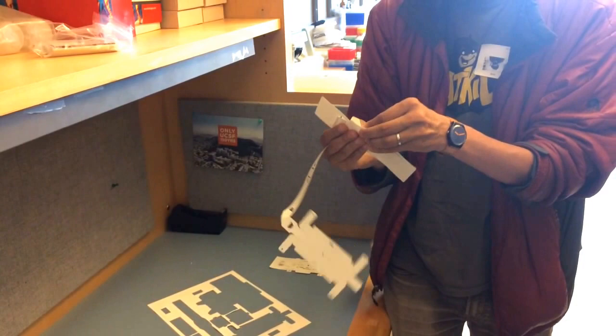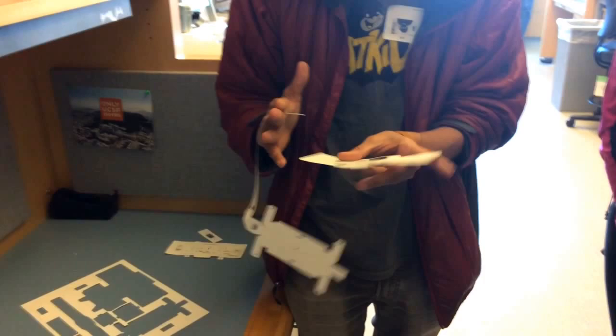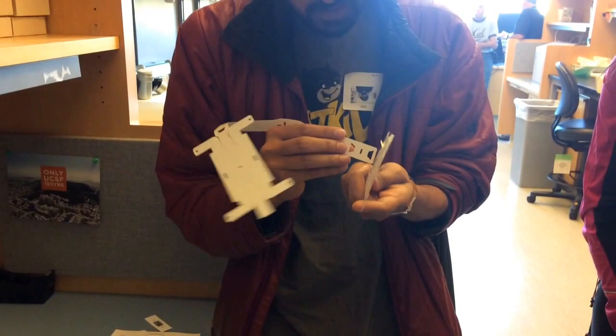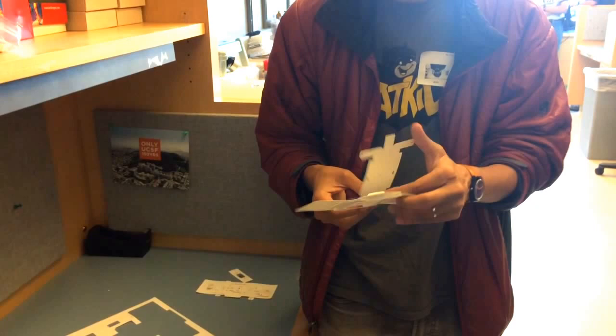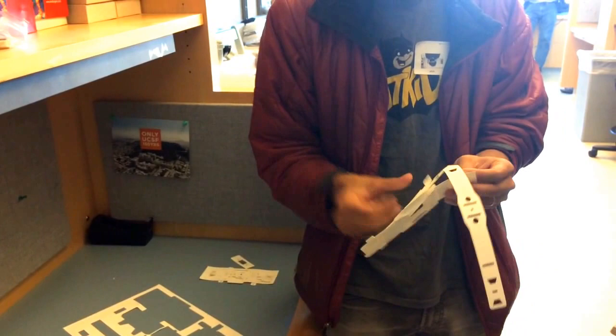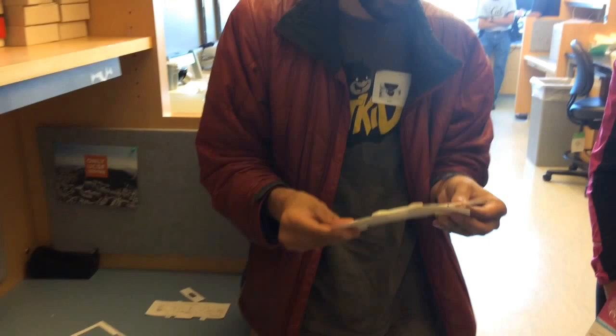So the key thing for thinking about why these folds are like this is that when I'm folding, it's actually aligning my own marks and objectives. So now what we need to try to do is essentially get, firstly, aha. Okay. Goes in here. We have to try to get everything through there. There we go. And now I'm going to weave this through. That's piece one. And then that's piece two.